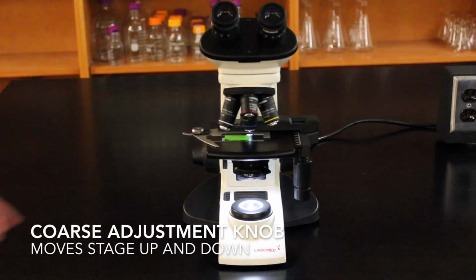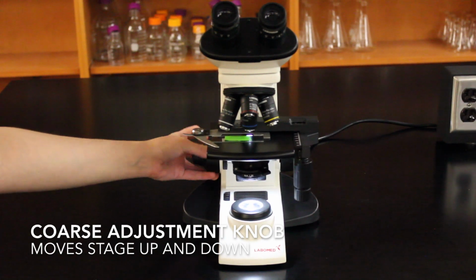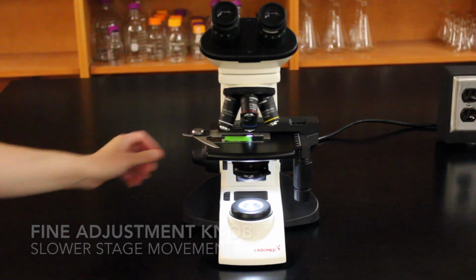To move the stage up and down, you'll use the coarse adjustment knob. Or, if you want to move it up and down slower, you'll use the fine adjustment knob, which will usually be by the coarse adjustment knob.